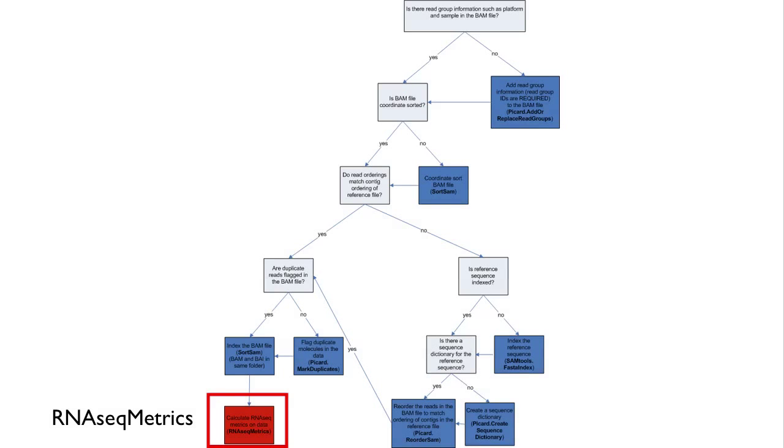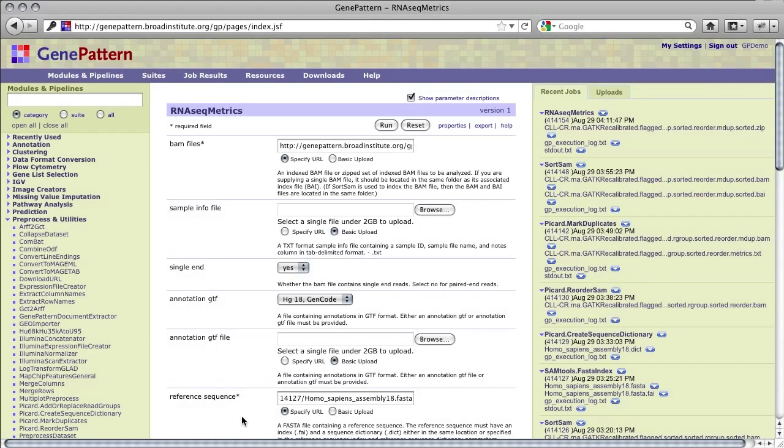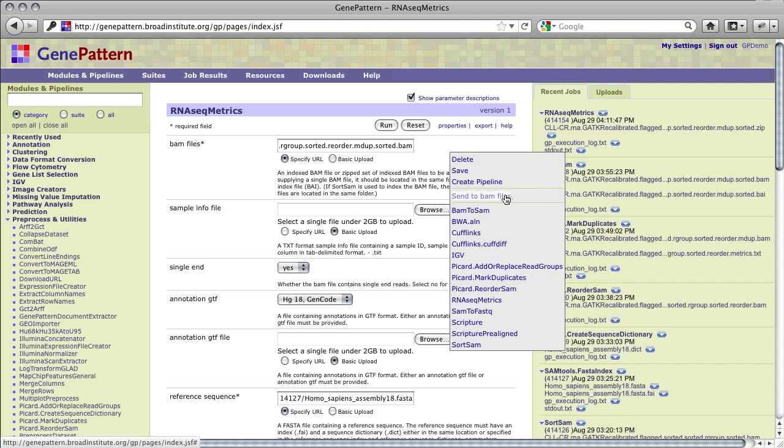Now that we have completed all of the prerequisite steps, we can run the final module in our workflow, RNA-seq Metrics. RNA-seq Metrics is the last step in the GenePattern RNA-seq QC workflow. The module calculates standard RNA-seq related metrics, such as depth of coverage, ribosomal RNA contamination, continuity of coverage, and GC bias. It takes the following as input: a coordinate-sorted BAM file containing a read group ID which has been reordered by Picard and optionally has duplicate reads marked, and its associated index. Here, the output from SortSam in the previous step has been specified as input.